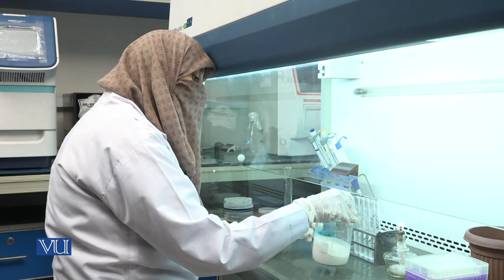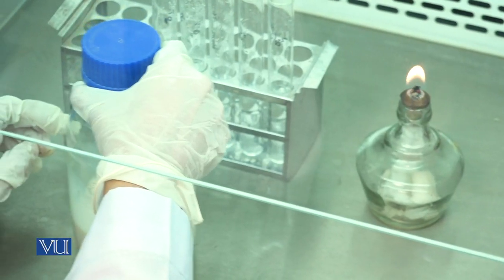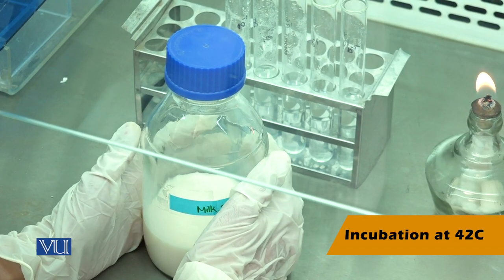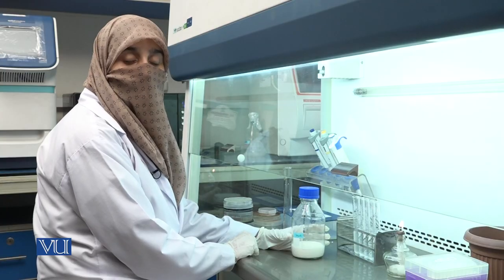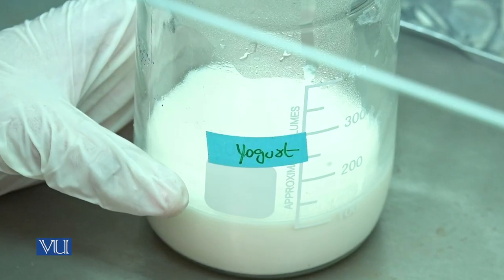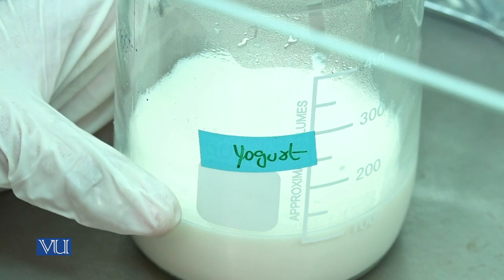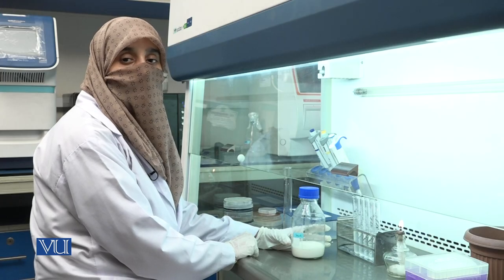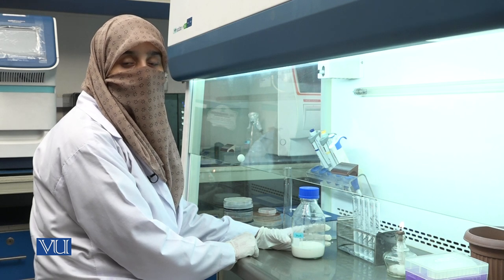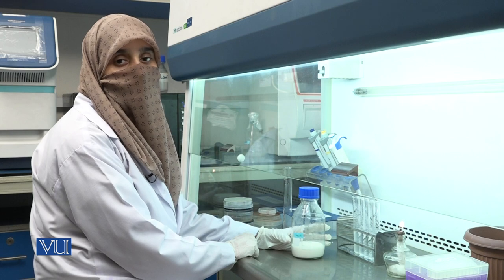Now mix the sample properly and place in an incubator at 42 degrees centigrade for 4-6 hours. After incubation for 4-6 hours, yogurt is prepared by the fermentation of lactose into lactic acid, commonly produced with the help of Lactobacillus species, including Lactobacillus bulgaricus and Streptococcus thermophilus.